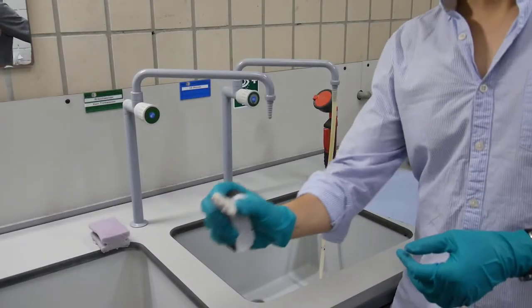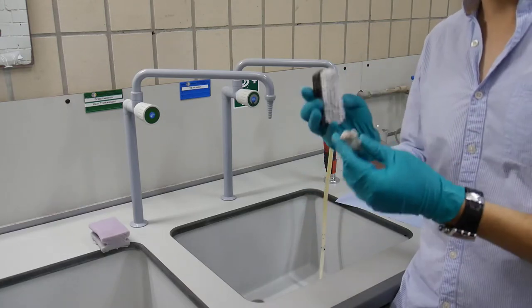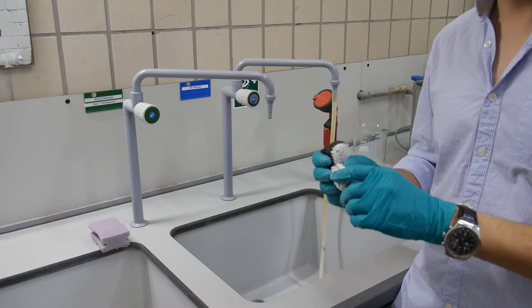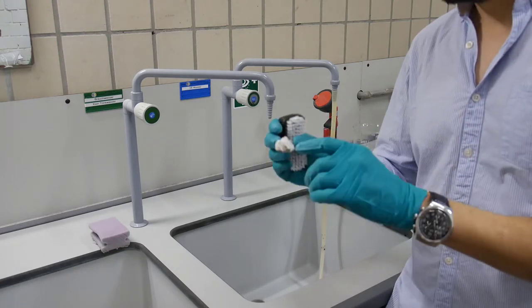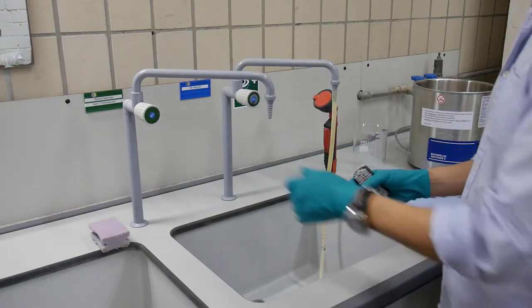For samples with a lot of vesicles, it's truly important to wash them with the brush and water, and even with the ultrasound, because material can go into these holes. So we'll go and wash this piece now.